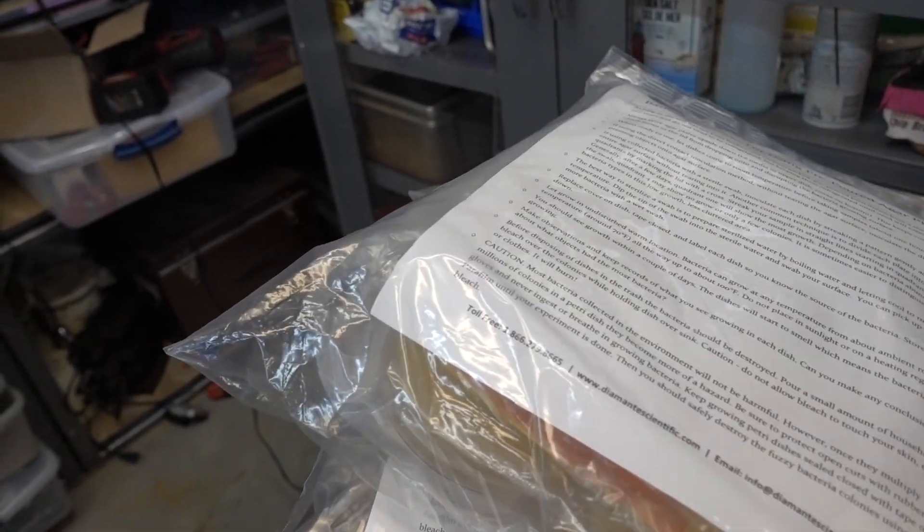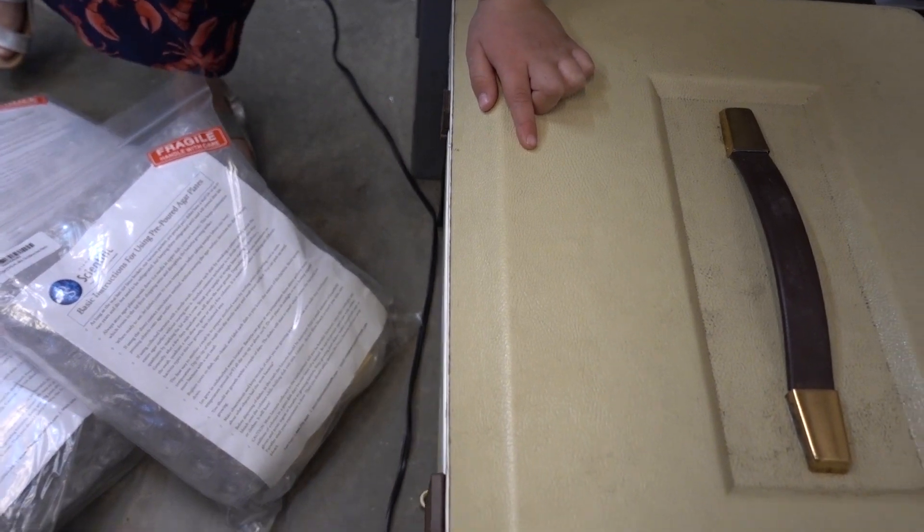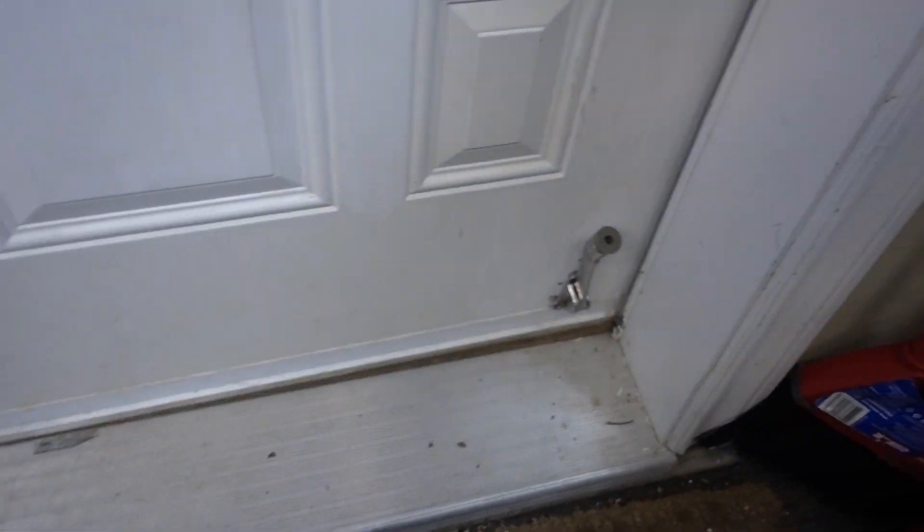Boys and girls, today we're doing an experiment. Oh, brother bear is here. We can use him too. He's got dirty little hands.